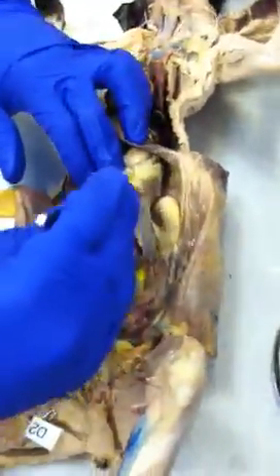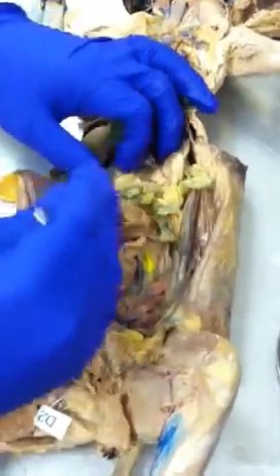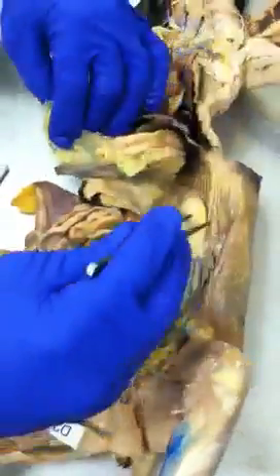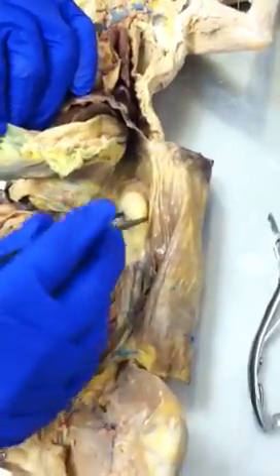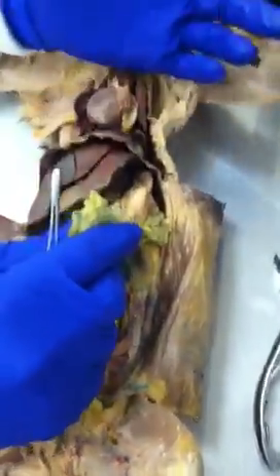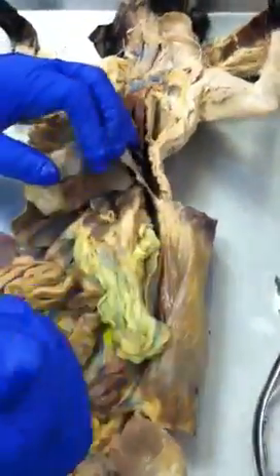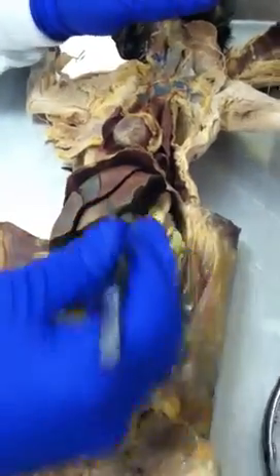Okay, and then this will be the spleen. You see the spleen on this side is attached to the great omentum and so forth. All right. And then what is this? Kidneys, right? But they're not part of the digestive system. But since they're there, and we don't really do the urinary system, whenever we see an organ here and there, I'll just show it to you and say it.